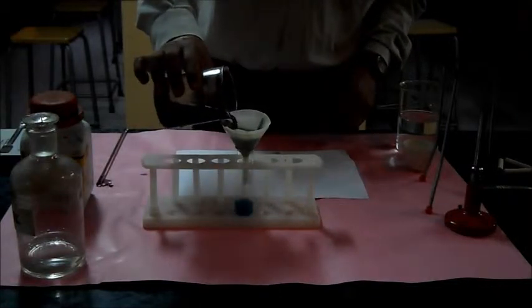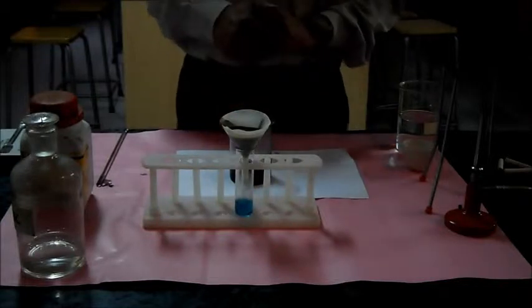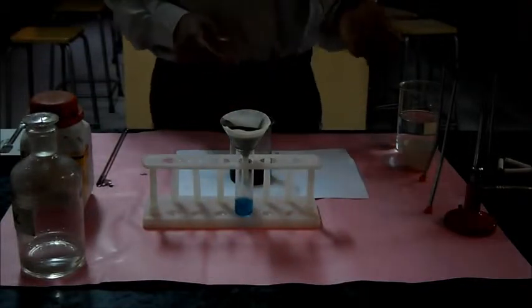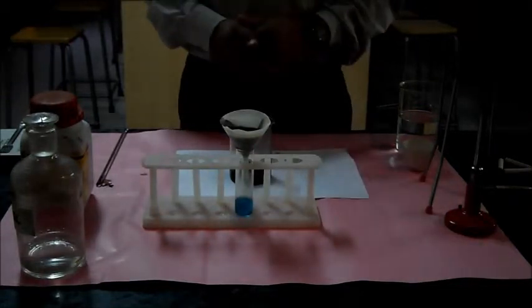Like this, we can filter the solution. And after filtering, the solution we can dry up by heating.